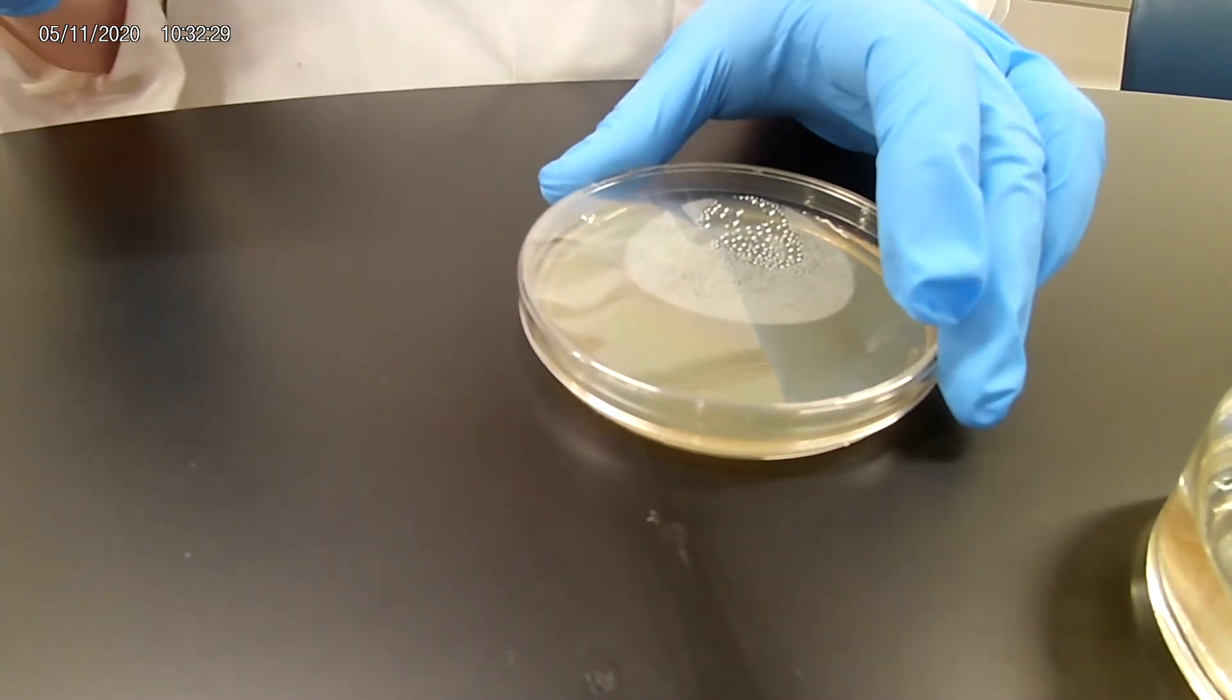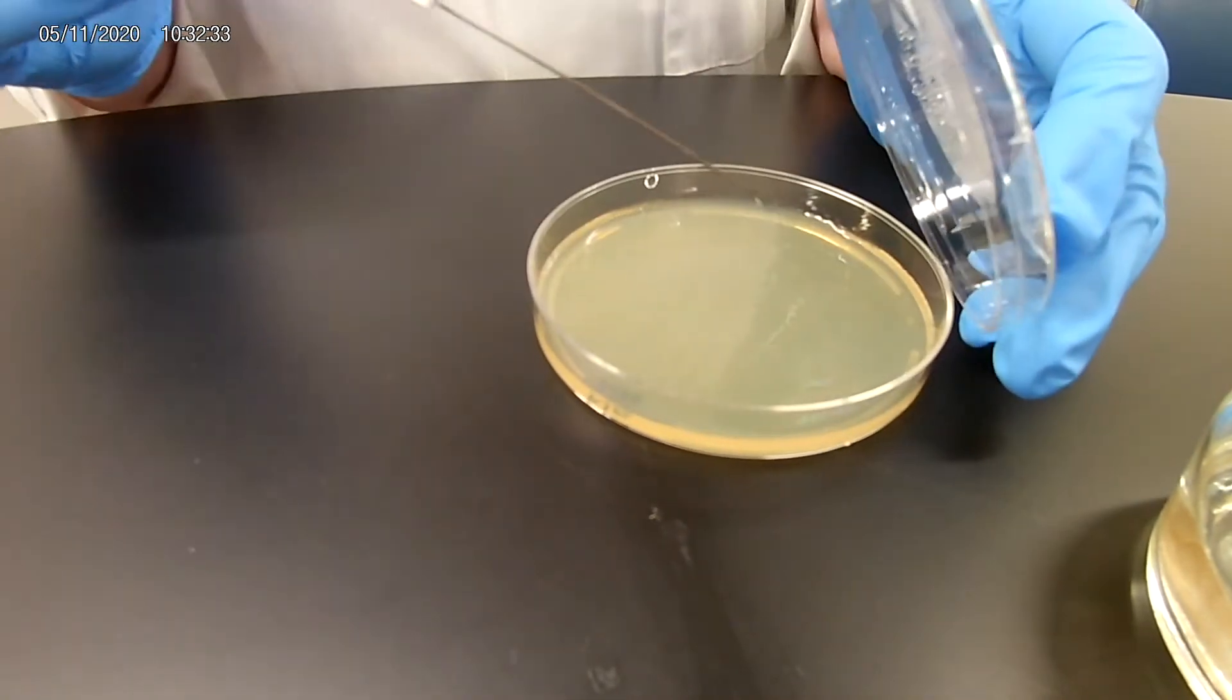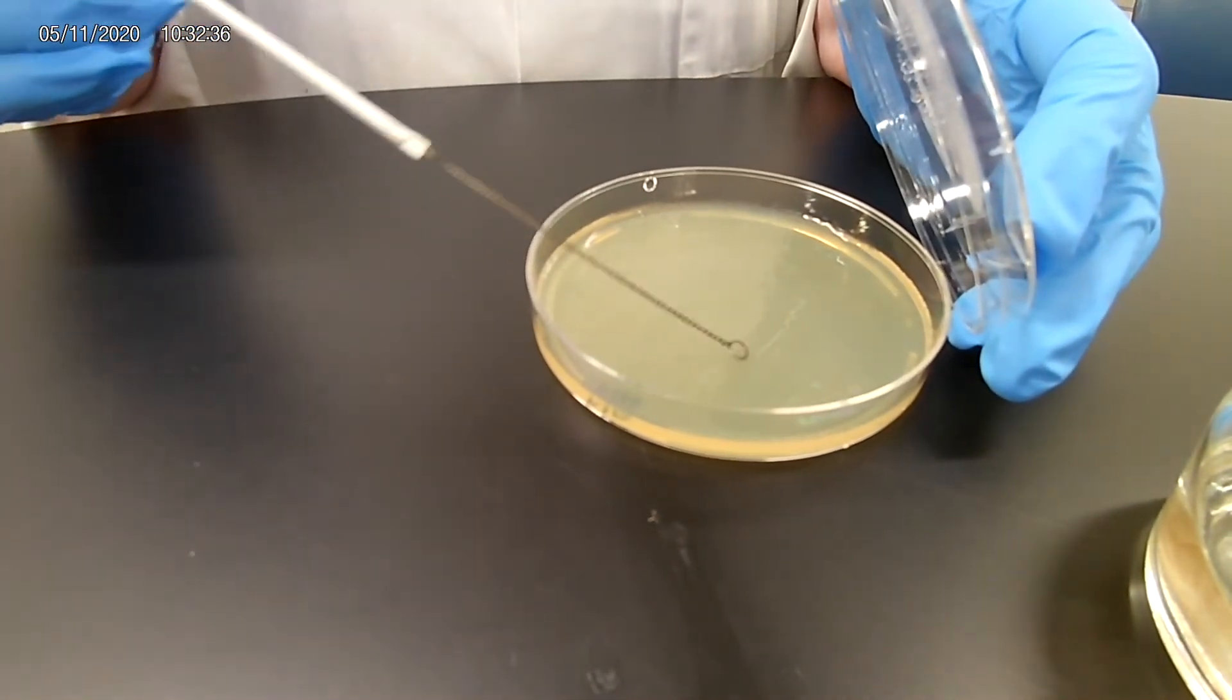Now what you're going to do once the loop is cooled, we're going to go into the second area that we had streaked in. We're going to spread it out.